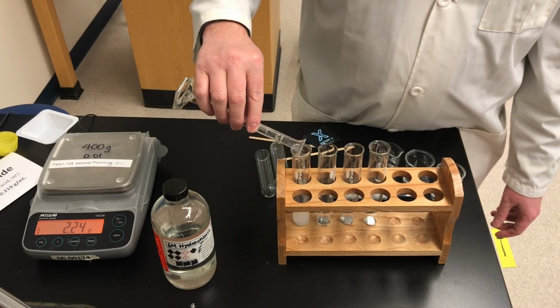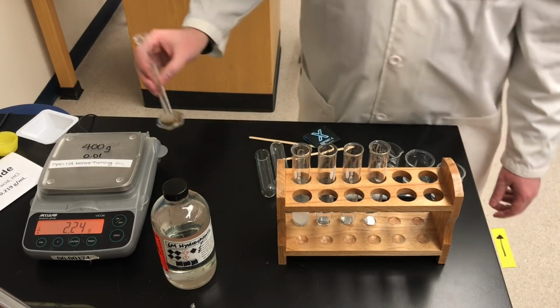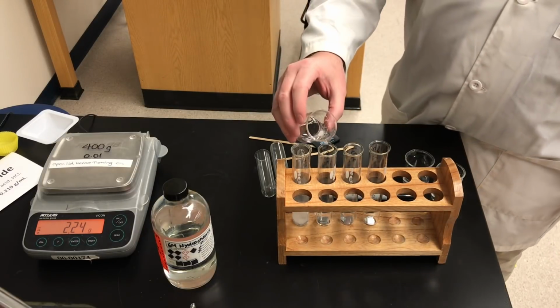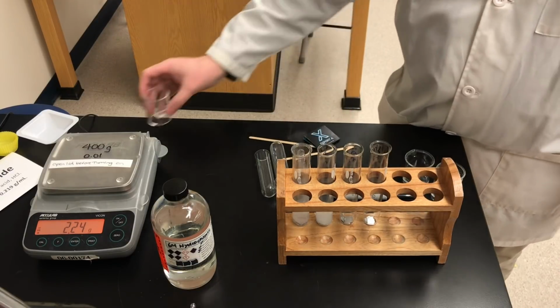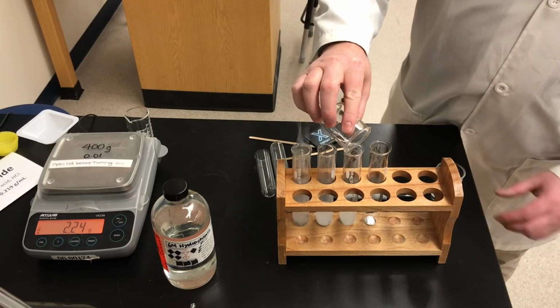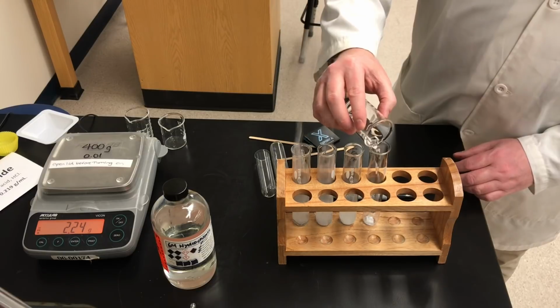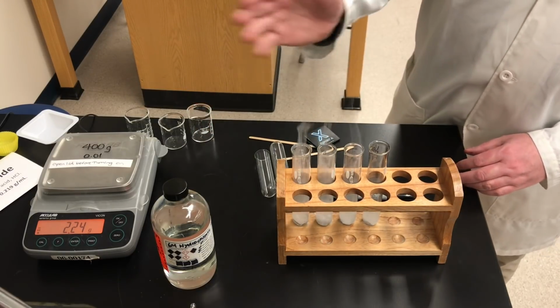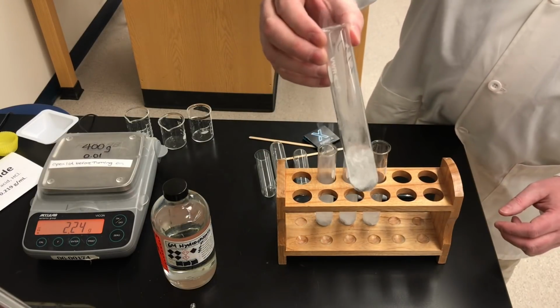I'm going to add that acid to the zinc pieces in the first test tube. Now I've already measured out hydrochloric acid in some beakers here, the same amount. So I'm going to put 10.0 milliliters of hydrochloric acid in each of the 4 test tubes. Now if you're looking carefully, you can see there's already a vigorous chemical reaction happening. There's evidence of reaction, there's bubbling occurring. If I feel the test tube, you can see the vigorous bubbles.